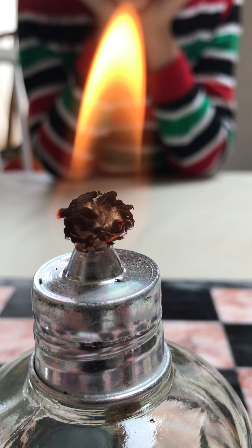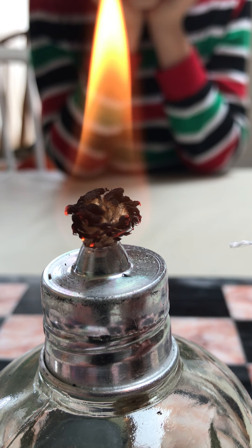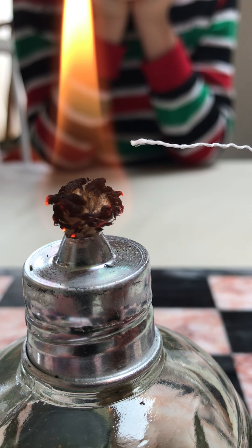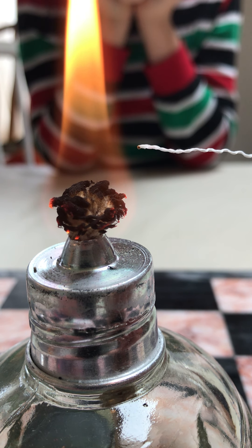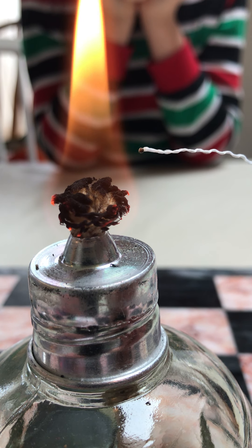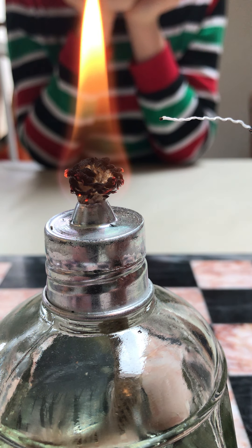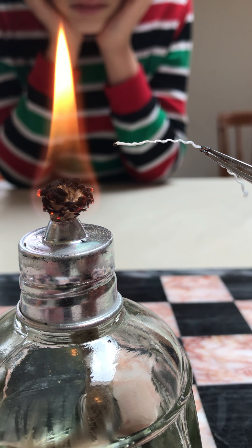We need to get a nice close view of our flame for this part of the experiment. We want to take our fiber and very slowly approach the flame with it to see what happens. If you look closely as the acetate approaches the flame, it kind of melts away from the flame itself and melts back along the length of it. That's what you'd record on your data sheet - it melts away from the flame.